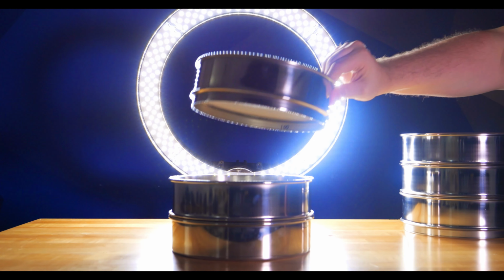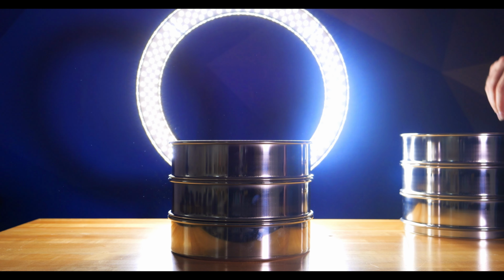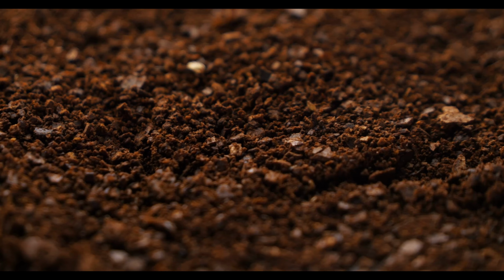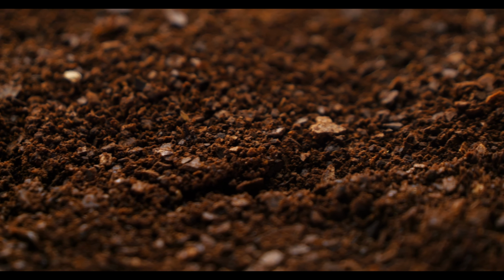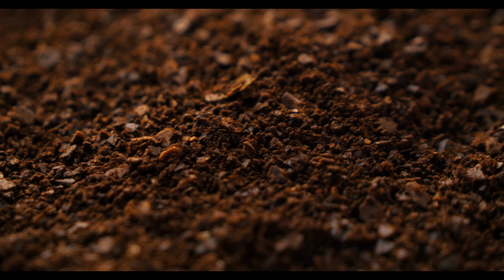Designing the ideal sieve stack is similar to how you design a sieve stack for other food production operations. When you're starting a new product or developing a new product and trying to calculate your particle size distribution, knowing the general size of the bulk of your material is key. So, for example, if the bulk of your material is 1 millimeter, you'd start with a 1 millimeter test sieve, then go either 1 sieve coarser or 2 sieves coarser, and then a sieve finer or 2 sieves finer. This all depends on how much you want to look at the material split or how much material you think is close to that nominal size.